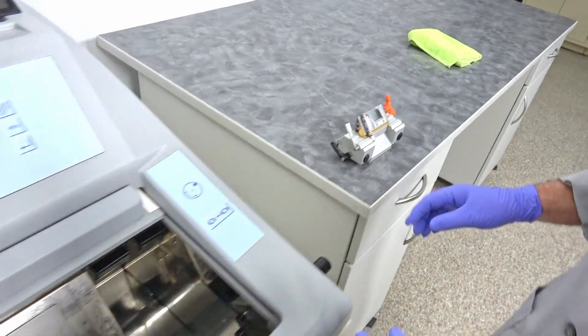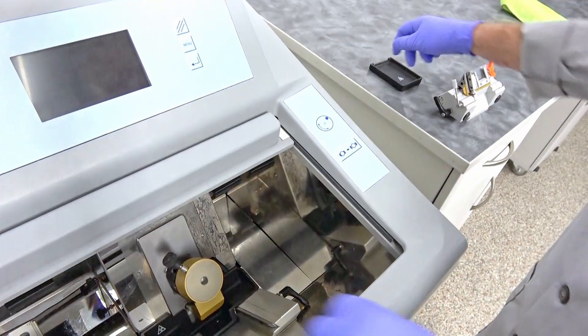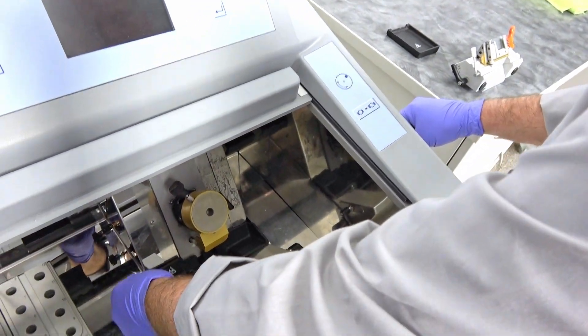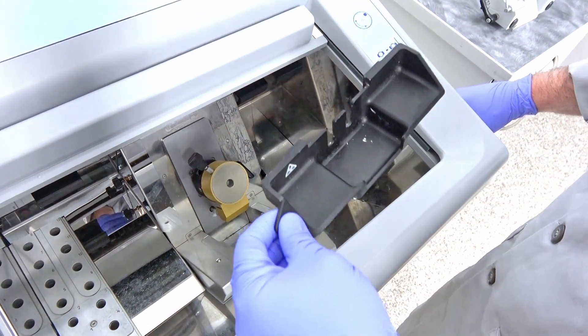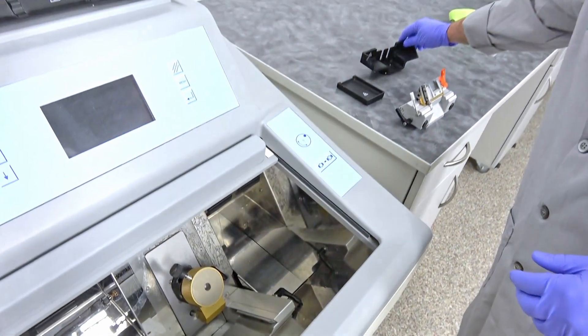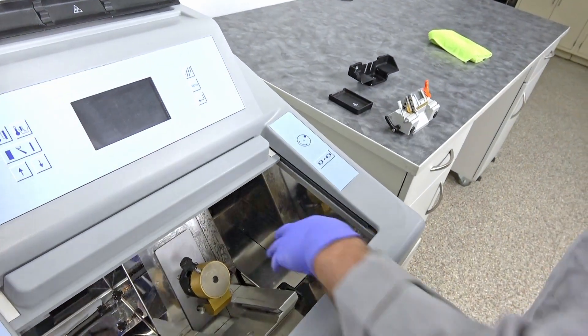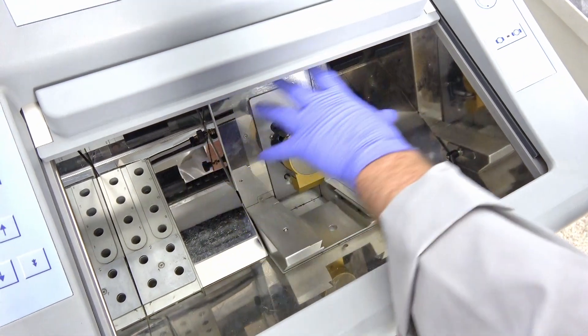While you're bringing this out you might as well bring out your trays - lift this up, bring out this tray because it's a good idea to take these all out so you can clean better. You can even take out these but that's not as important as what we just took out.